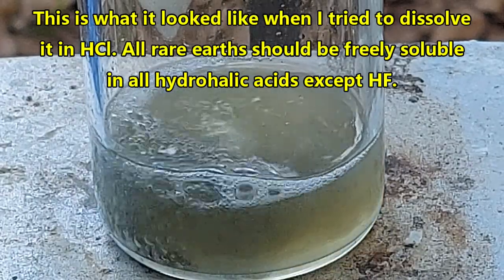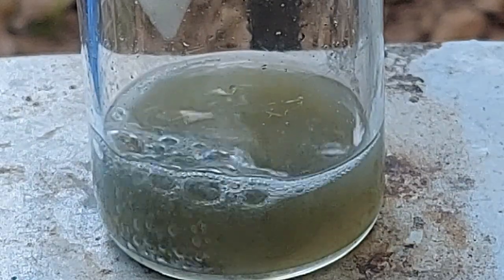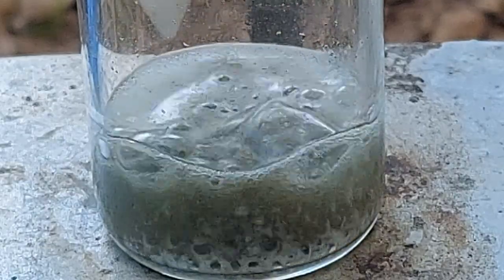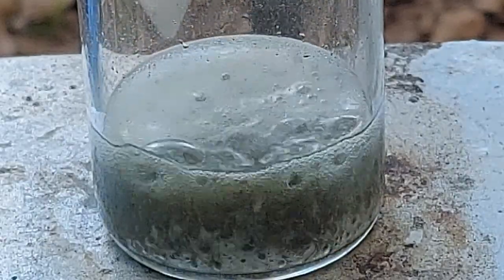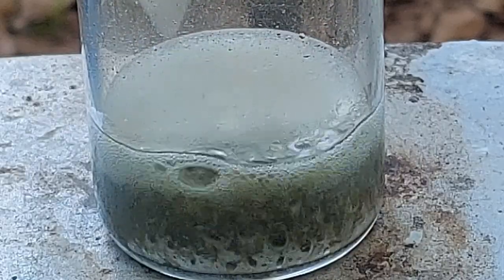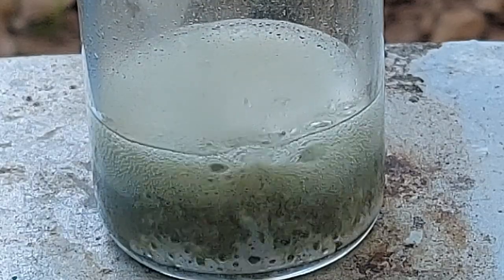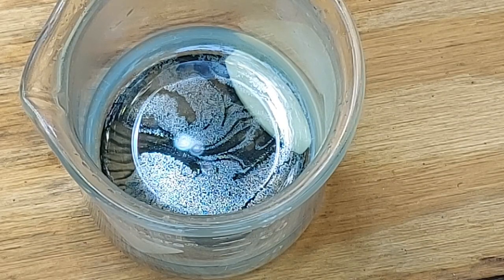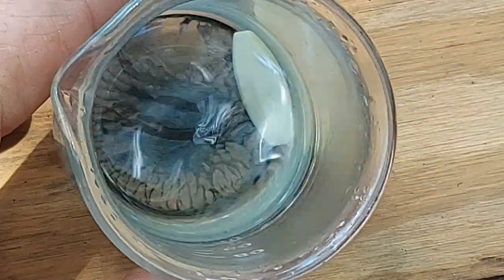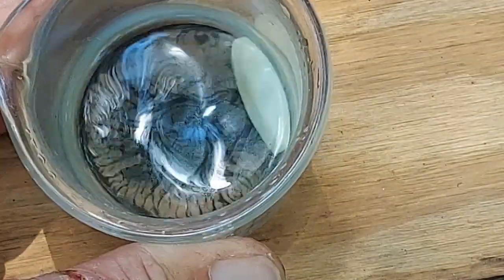And there is this residue that is left over that it will not dissolve in hydrochloric acid, not dilute, not concentrated, not room temperature, not hot. The stuff is absolutely impervious to hydrochloric acid. Now, 0.1% of 2 grams is 2 milligrams. Now I ask you, does this look like 2 milligrams of stuff?